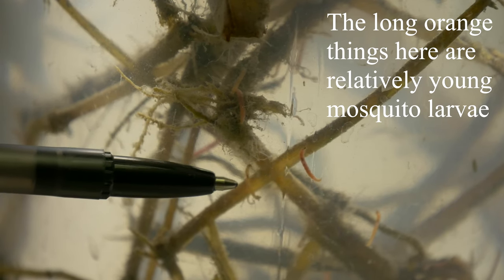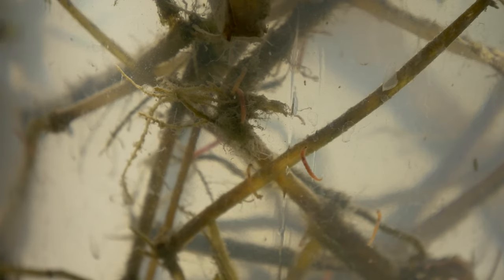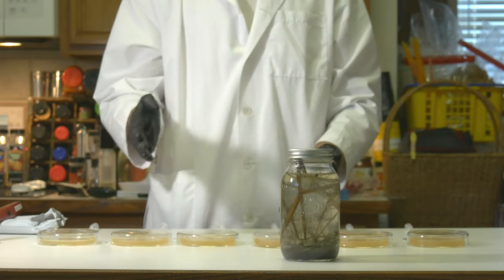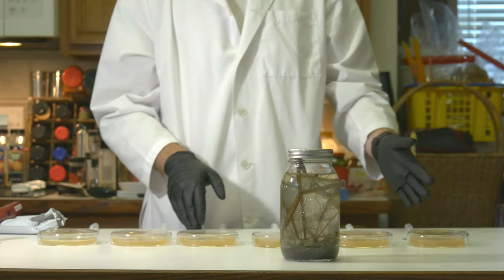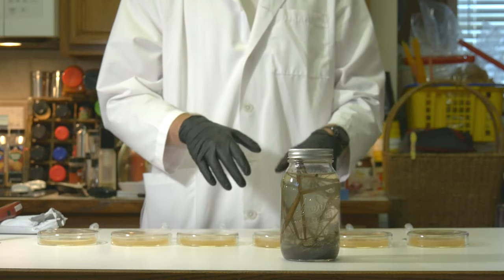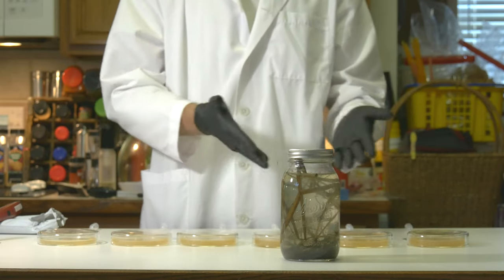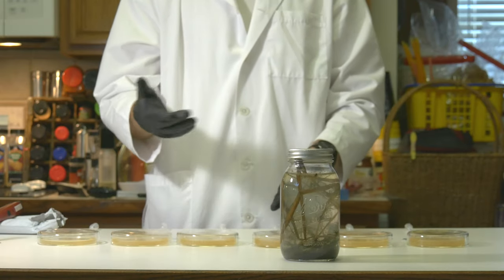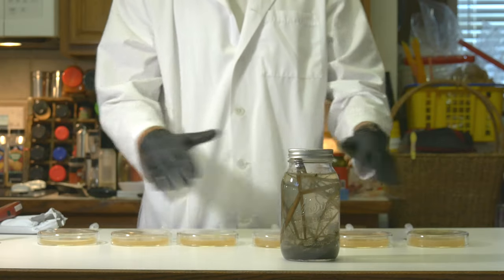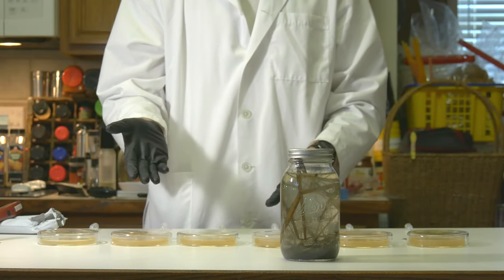Basically I'm going to walk you through visually why you should sanitize water, in one basic way which is to boil it for up to one minute. I'm going to do it in increments of 20 seconds — 0 seconds, 20 seconds, and so on until a minute — and hopefully show you the levels of eukaryotic organisms like the larger swimmers in the microscope, and then show you what can grow on these LB plates here, which would detect the dangerous bacteria that could be present.